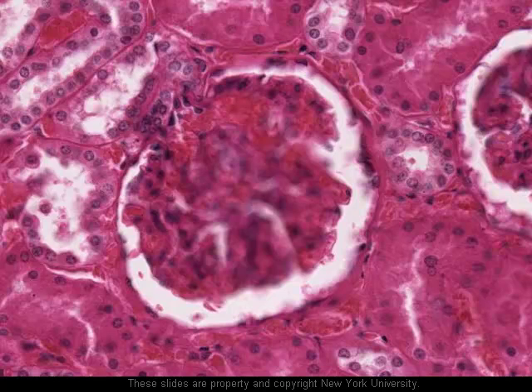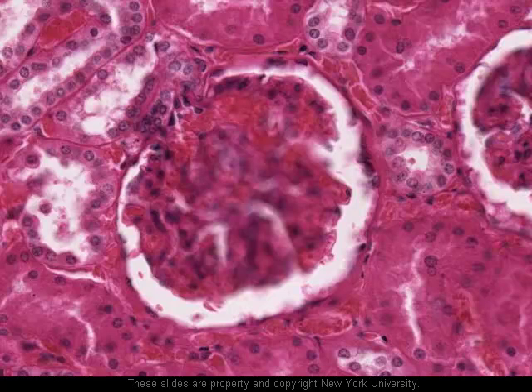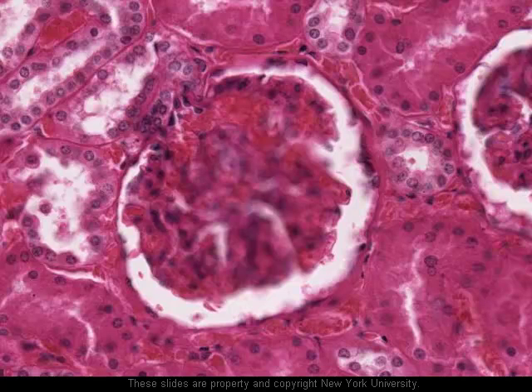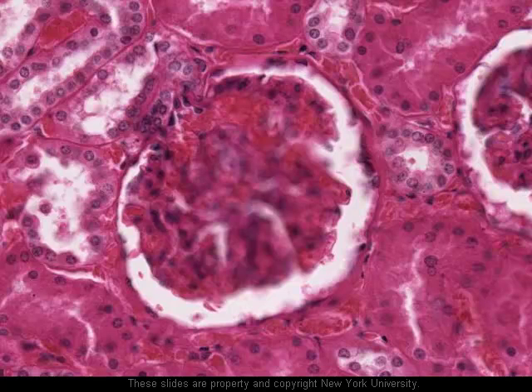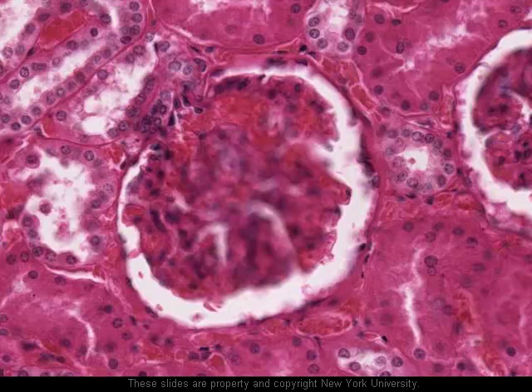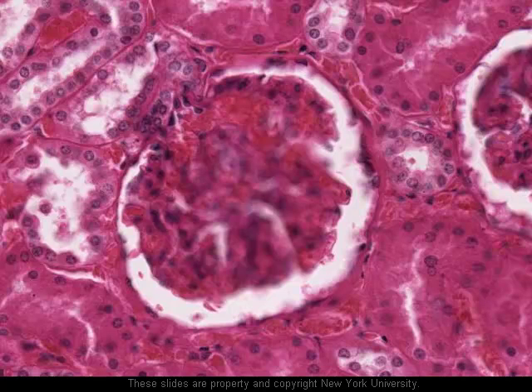Finally, just because we happen to have a good example in this region, let's take a look at the juxtaglomerular apparatus and the macula densa. As you know from your notes, the macula densa is a modified part of the distal convoluted tubule where it passes by the vascular or arteriolar pole of the glomerulus. It and some modified cells in the wall of the afferent arteriole collectively form a structure involved in the secretion of renin — an enzyme that regulates the activity of a hormone that controls blood pressure — and also probably in the secretion of erythropoietin, a hormone which stimulates the production of additional red blood cells.